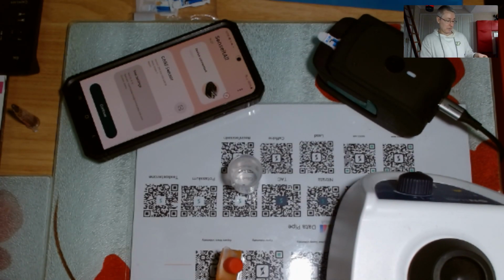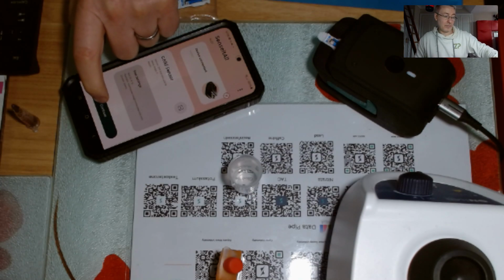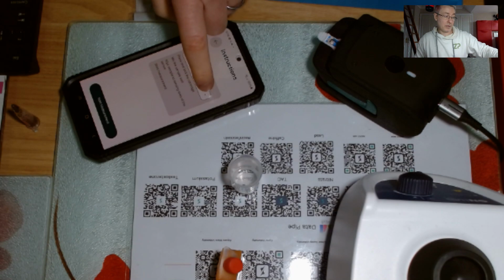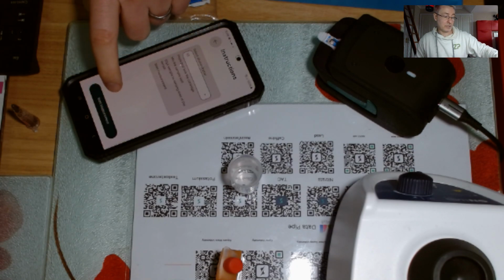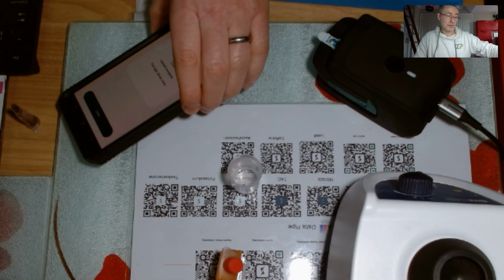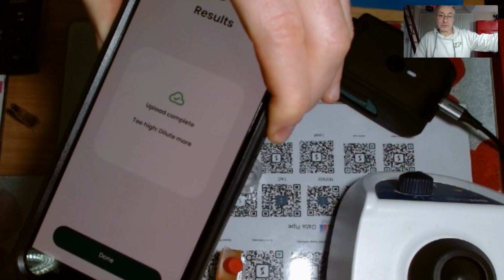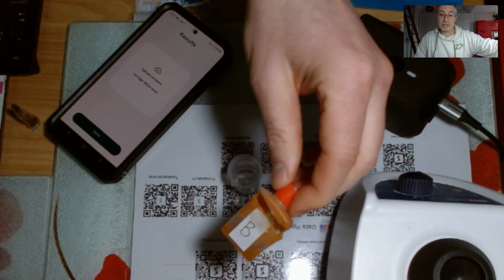Right. Now, again, I'm going to put 50 microliters onto the sensor. Right, and I'll continue. That was a 1 in 10 dilution, so I'll make sure I chose that, and then I go start, and off it goes. So it's running. Right, and I did this on purpose, okay? Please understand I did this on purpose because I wanted to simulate essentially their errors. And now I've actually got upload complete, too high, dilute more. And I'd chosen that sample because I knew in the end that it would throw that error.